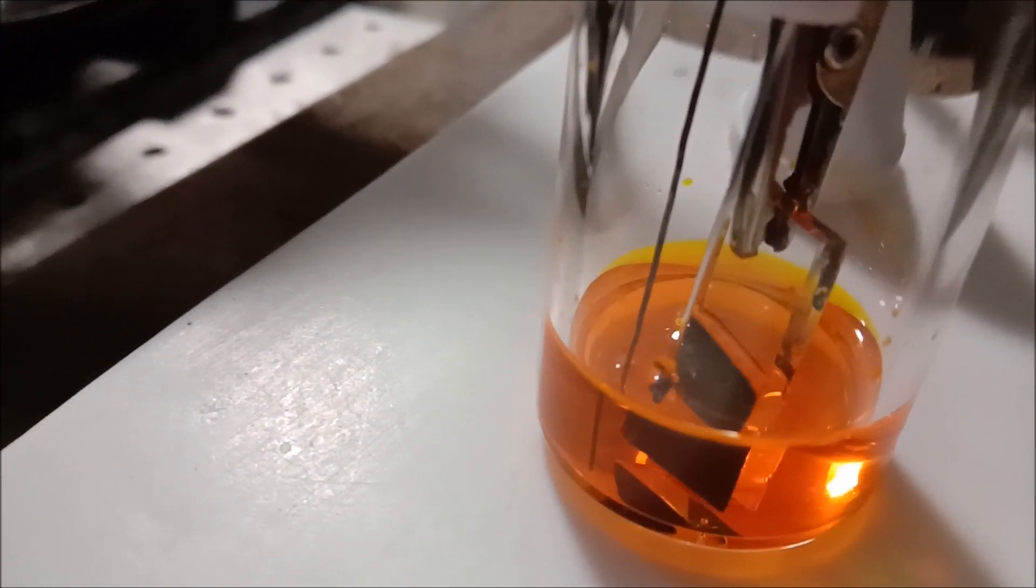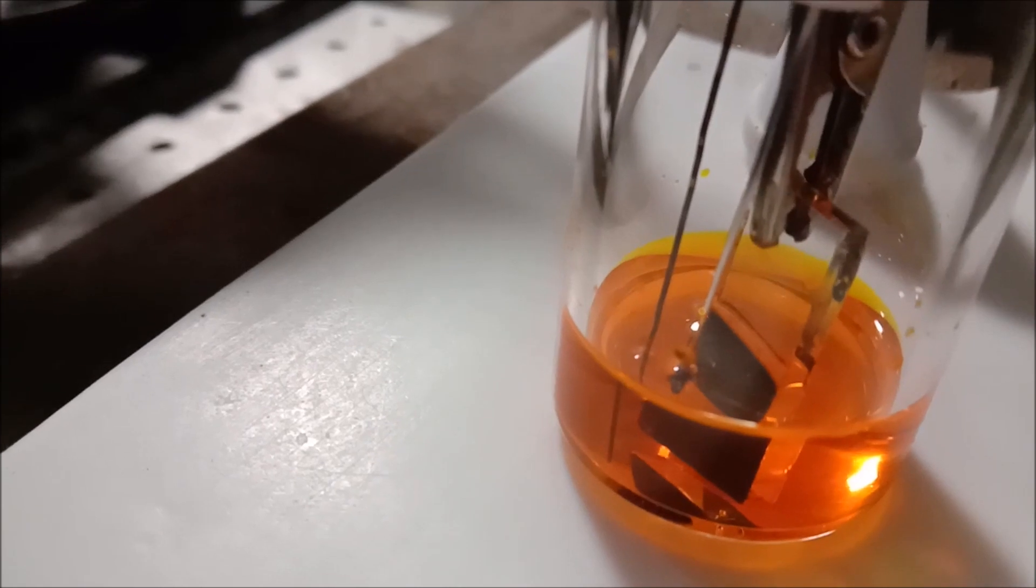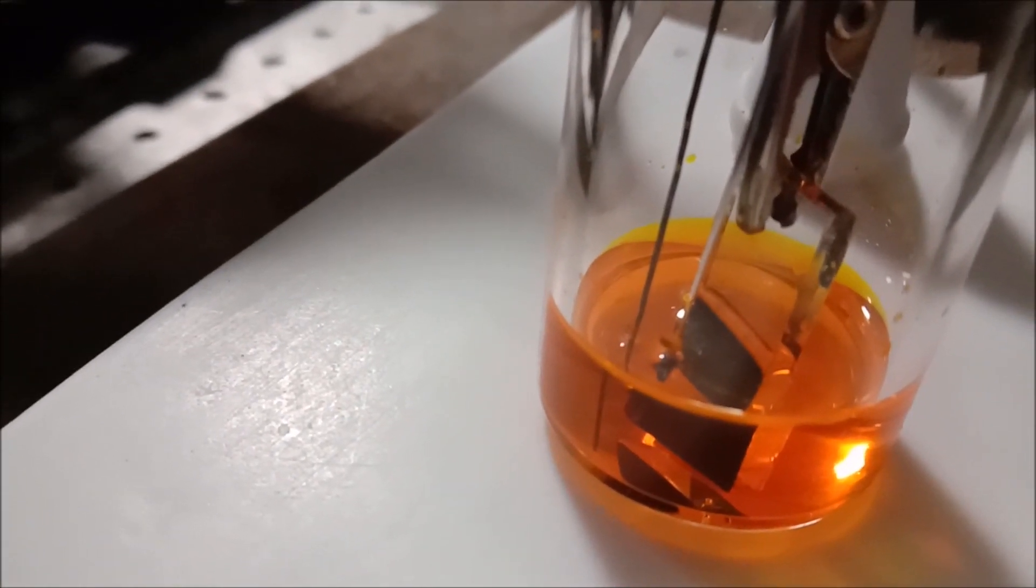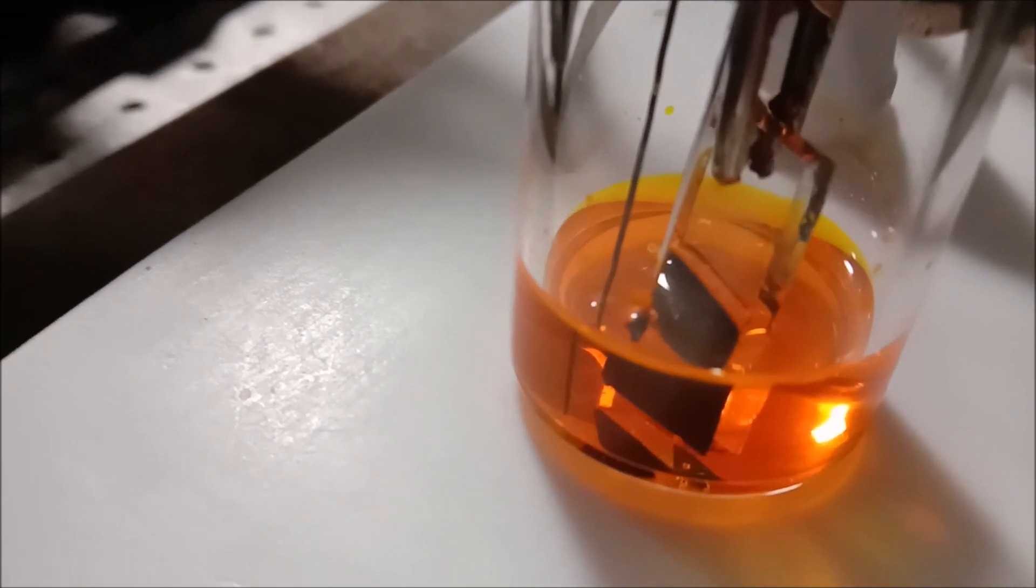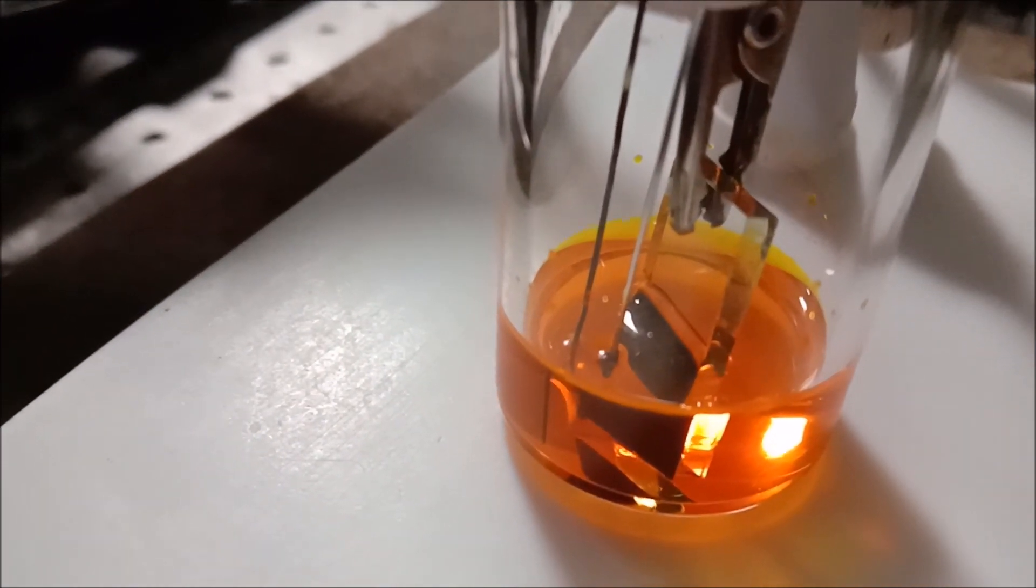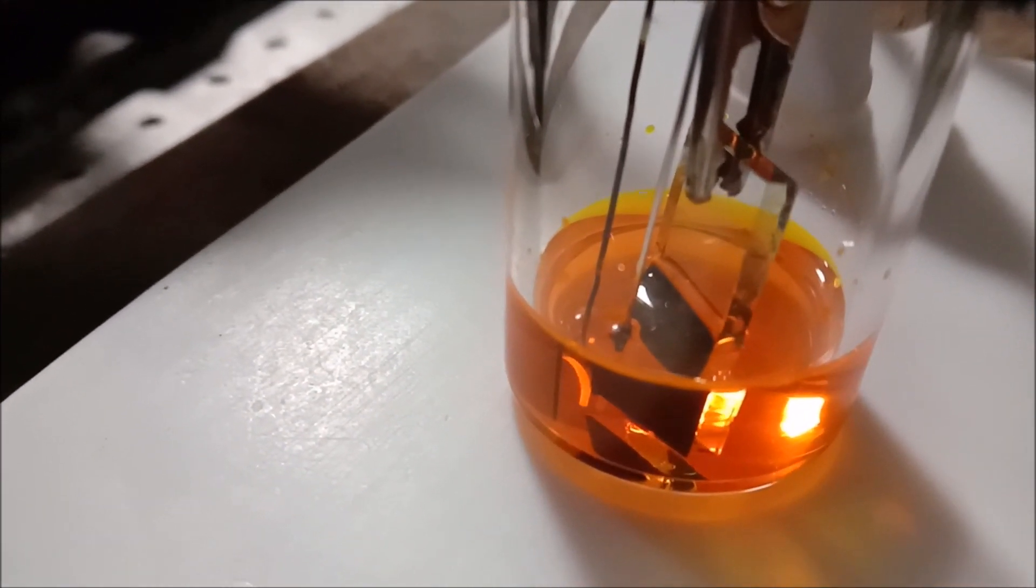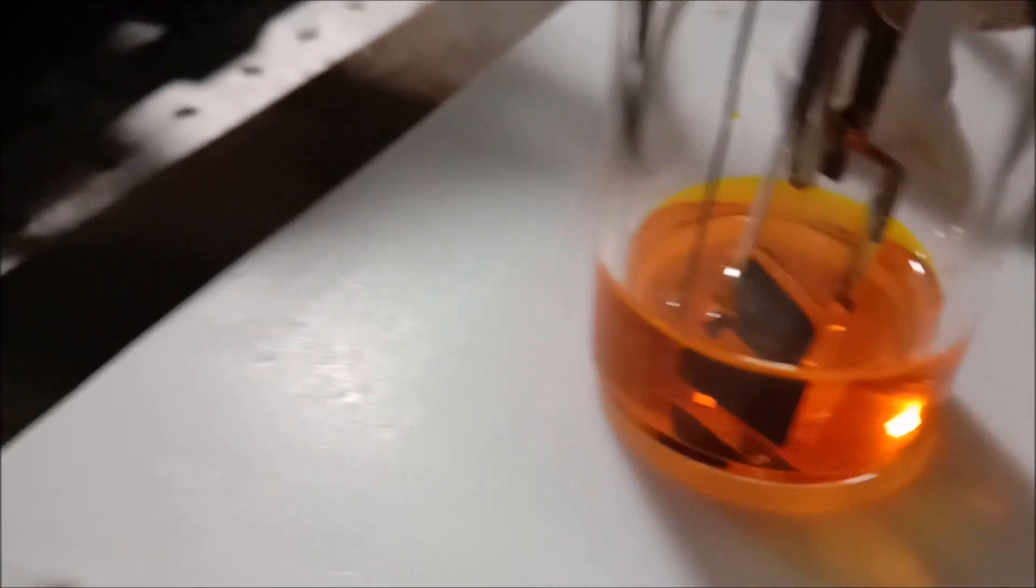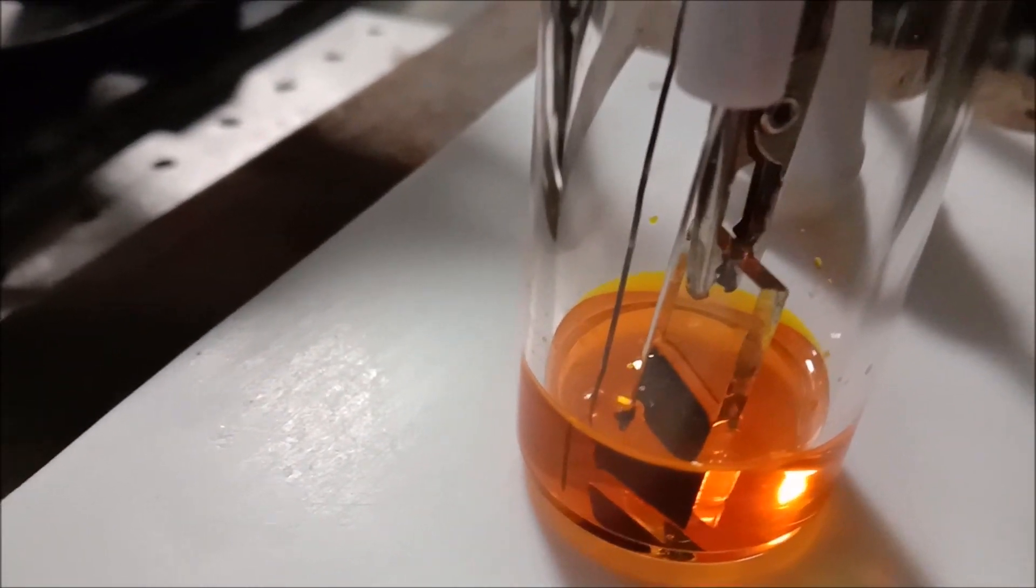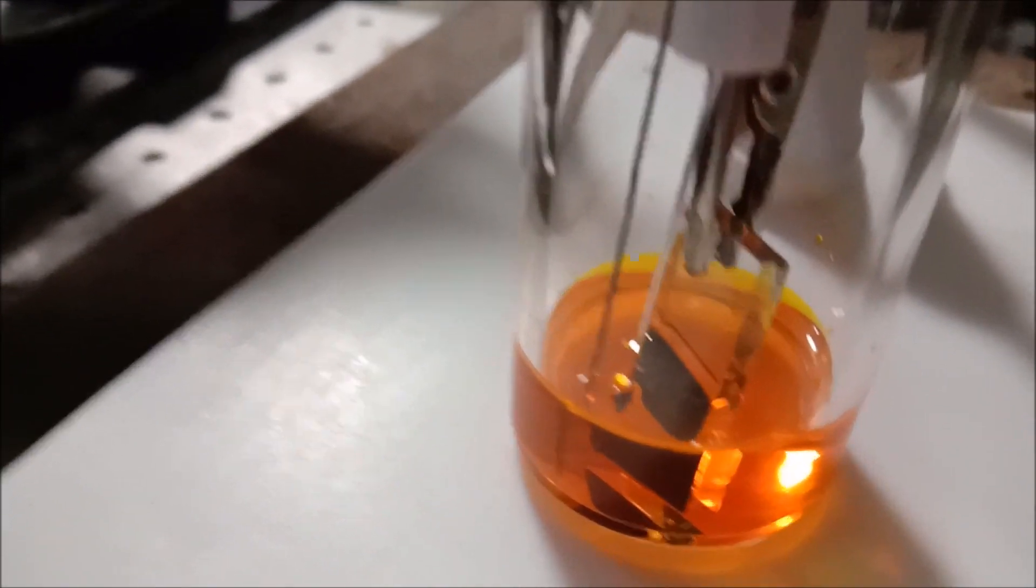Current can't pass quite easily right now because of that layer which is limiting the current flow and hence the film formation. You have seen that in the computer the current has decreased substantially. It is saturated, almost saturated.